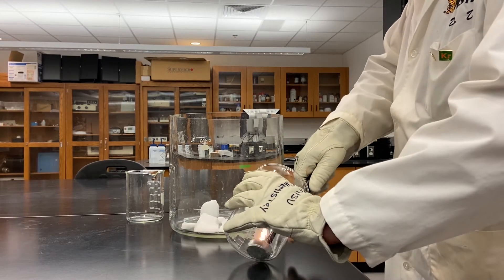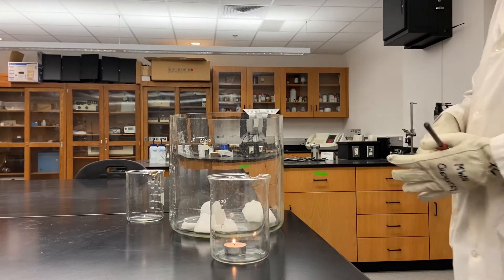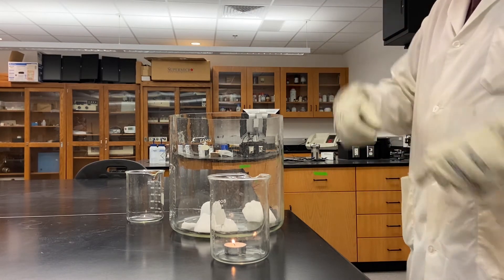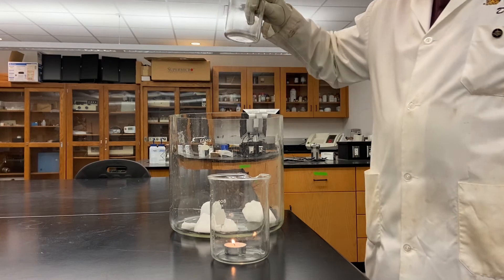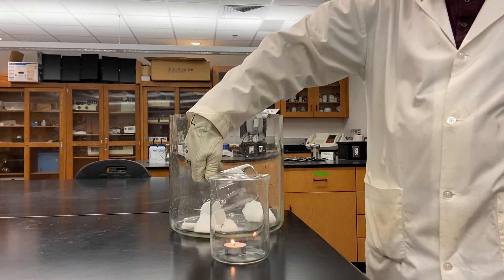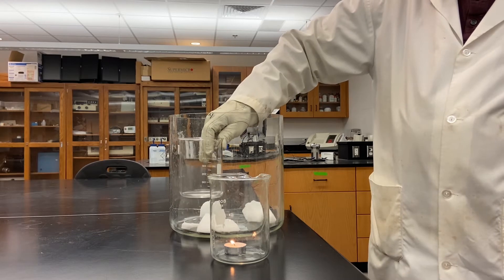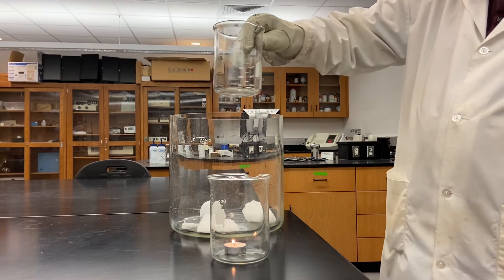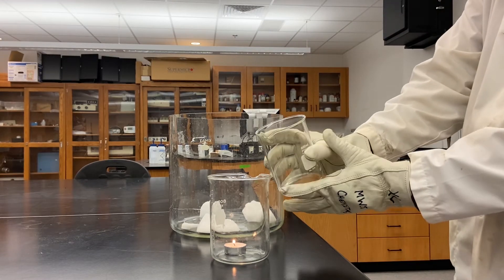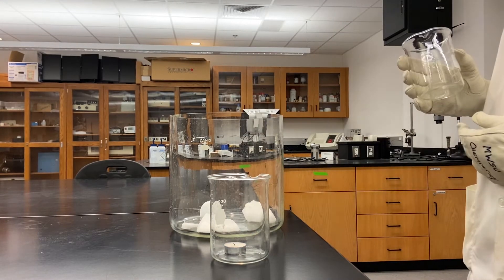Now I'm going to do another example. I've got a candle here in this beaker. You can see the candle is burning right now because there's oxygen inside that container — it's just air in there. What I'm going to do is dip into this container of carbon dioxide, go all the way down to the bottom, and fill this beaker with carbon dioxide. Of course you can't see it because carbon dioxide is a clear colorless gas, but we can see evidence that the carbon dioxide is in fact in there — when I pour it into the other beaker, the candle snuffs out.